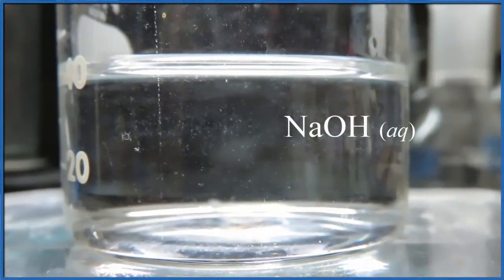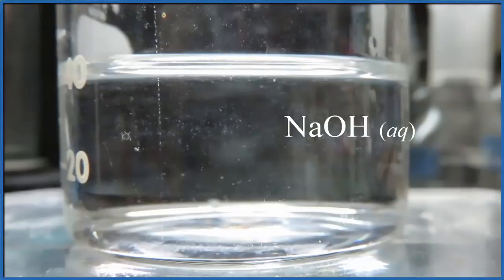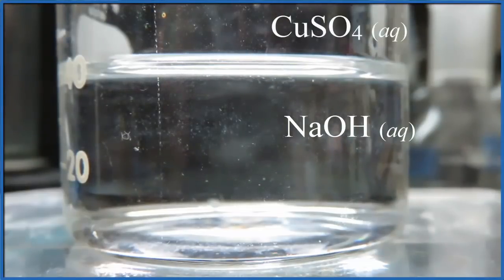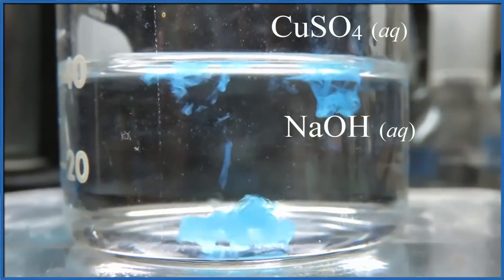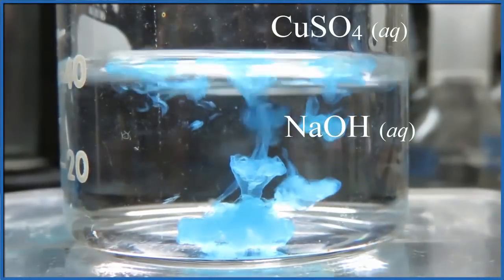This is one of my favorite reactions. We take sodium hydroxide, it's aqueous, dissolved in water, and we drop in copper sulfate, which is also aqueous, dissolved into its ions.